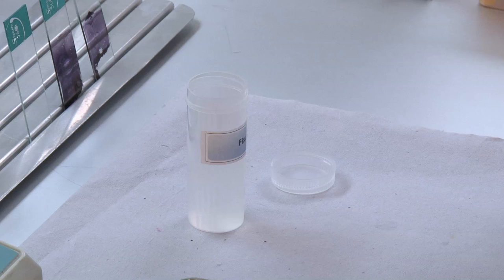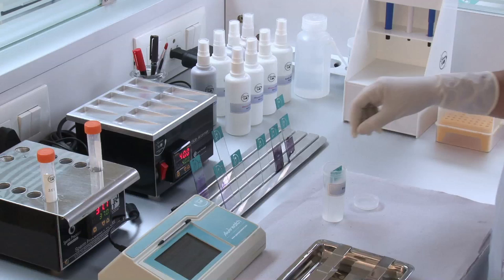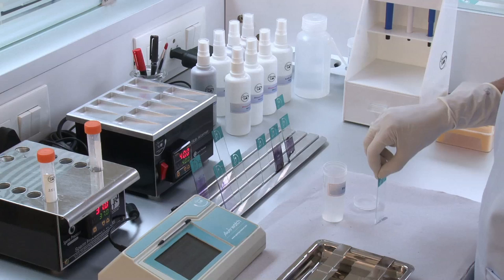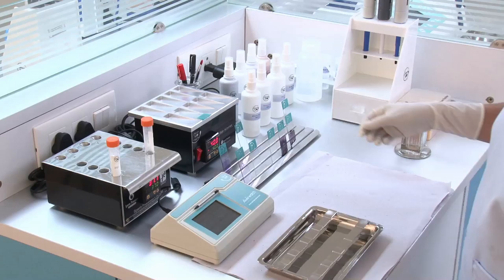Dip the slide in fixative 95% ethanol and keep it for 15 minutes. Drain off the solution, then keep the slide on the slide warmer to dry.